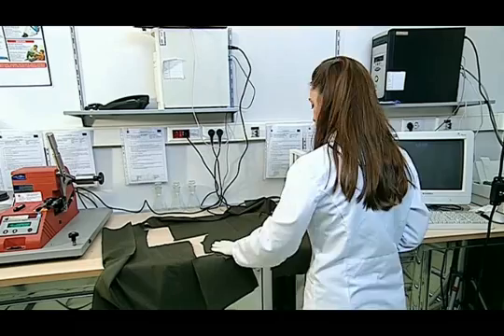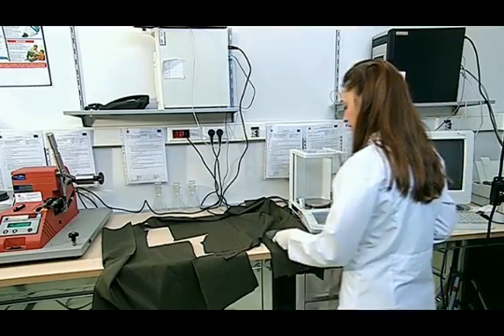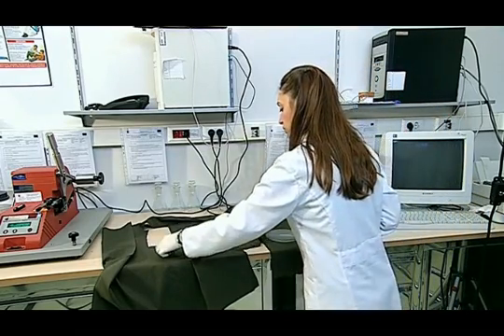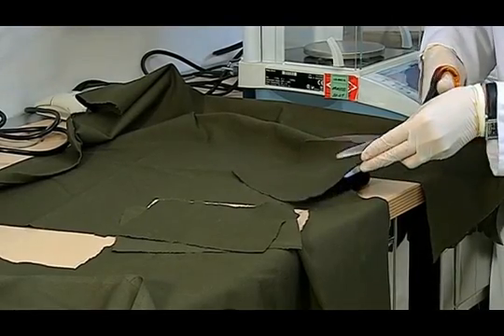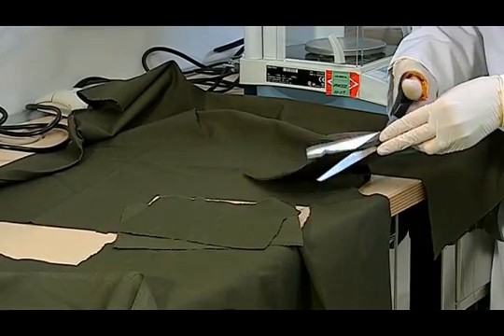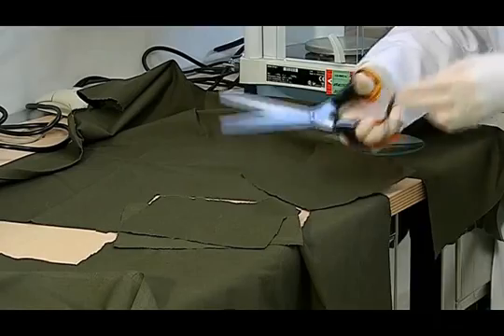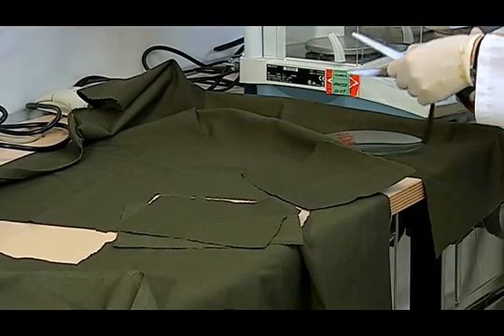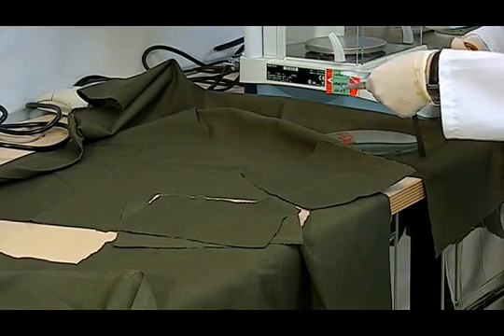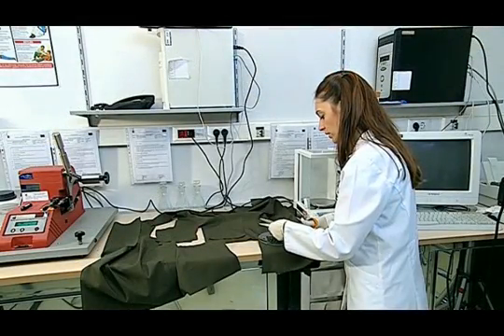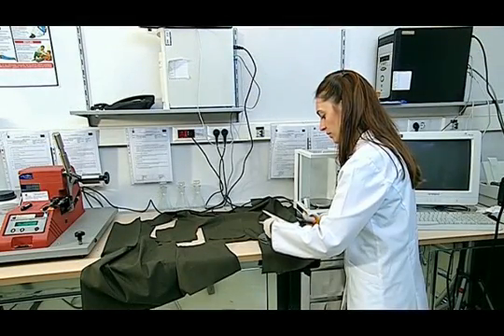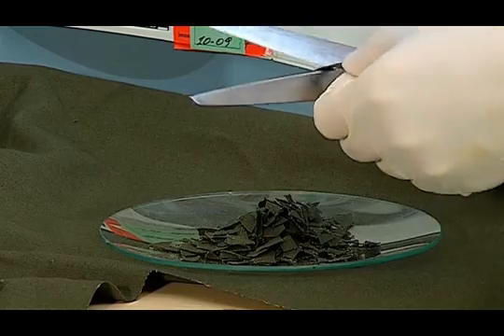Now, I take the first of three pieces that we have cut off and I cut them again into small pieces, which must be not bigger than 0.5 cm. We must not forget to wear gloves, so that the samples are not affected by any sweat.